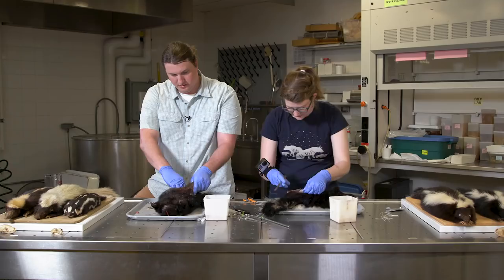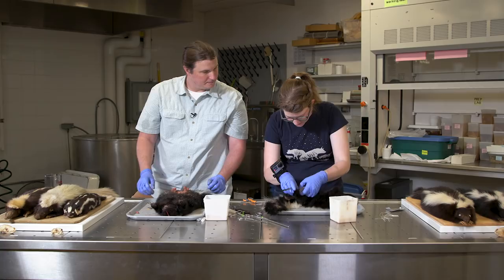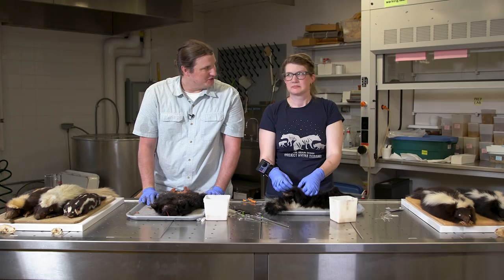Look at the grease on my hands from the fat — that's disgusting. That's another reason to double-glove. I'm afraid I'm going to put my hand right in the anal glands. Basically the glands are big, giant, ping-pong-ball sized in a big adult, and these muscles go around the side — that's what they use to contract.